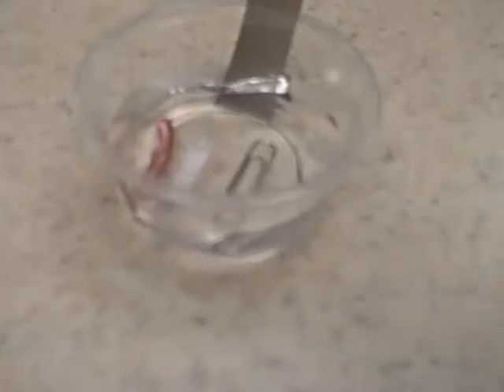Rate these samples 0 to 10. This is only 0.25 molar HCl. I was admonished not to go any stronger in HCl with the kids, so 0.25 will have to do it.